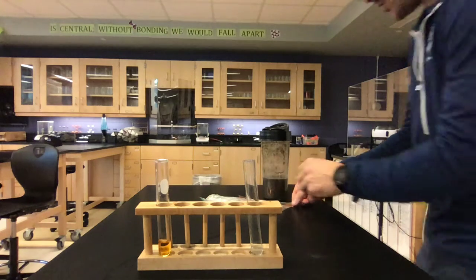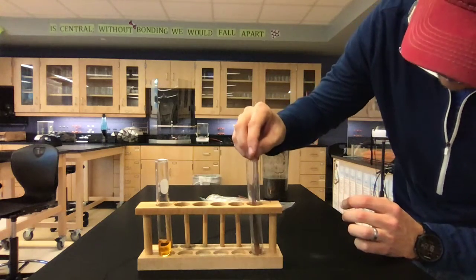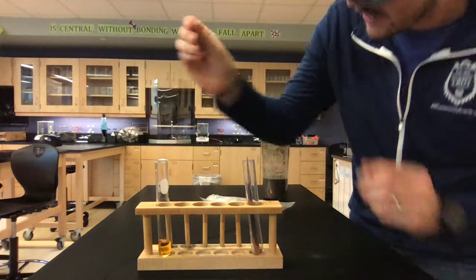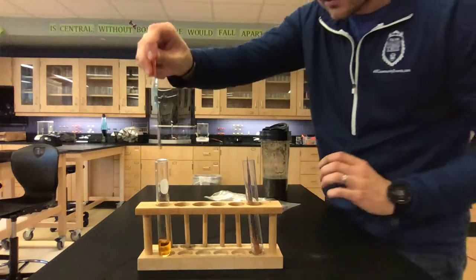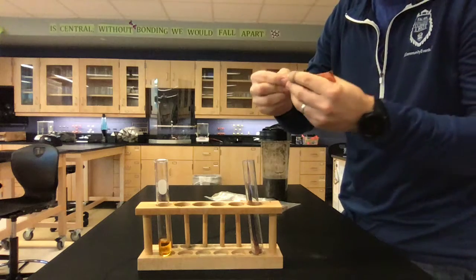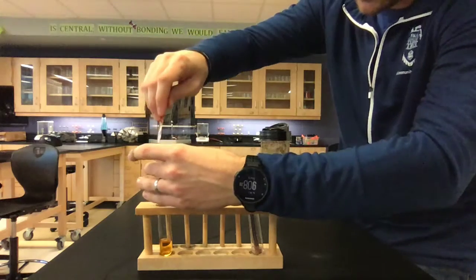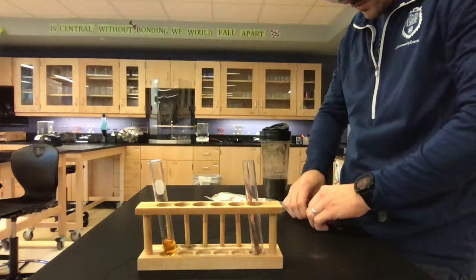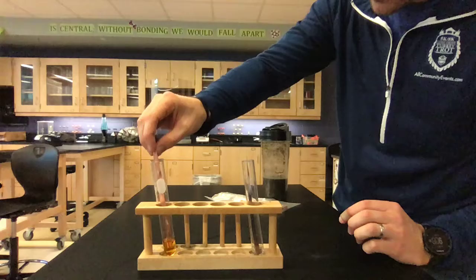And then we'll take our two pieces of copper and just go ahead and slide them down and make sure that they are touching in the solution. So we can go ahead and actually model that solid copper just resting in the solution. I may have to actually bend this copper here to make sure it gets in the test tube. And check out how easy this stuff is to bend. Metal, properties of metals, right? Super flexible and easy to bend. It just doesn't want to go. There we go. Now you can slide that all in and sink it in.